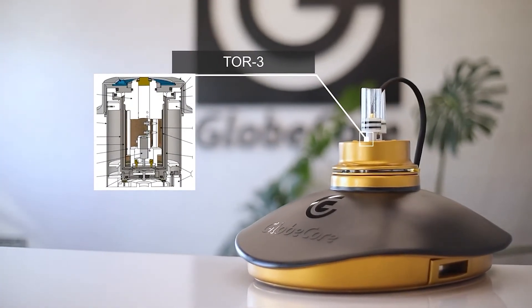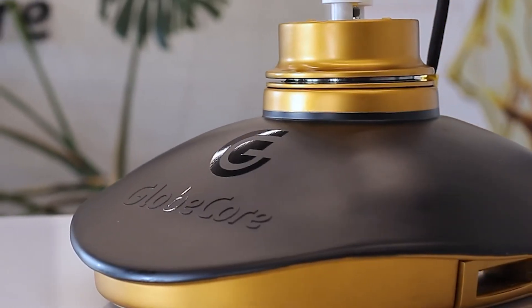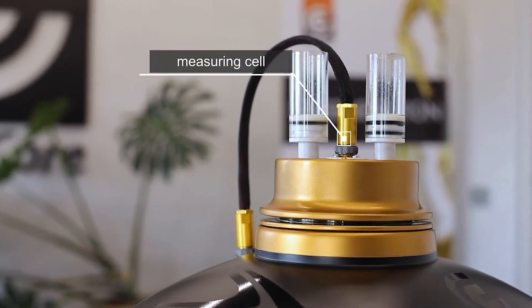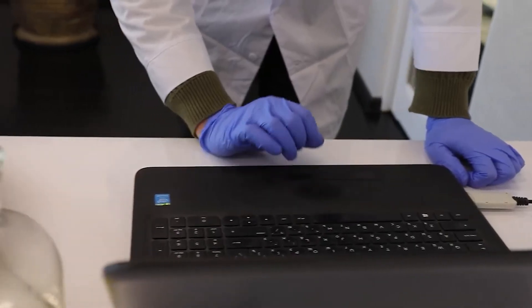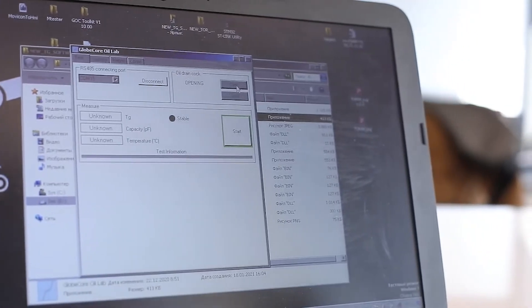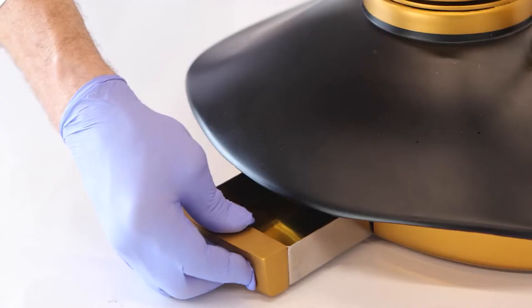For ease of use of the TOR-3 device, the transition to testing the next samples is done without removing the cell. Simply send a command from the computer to open the oil drain valve, let the oil flow into the special tray, and then place a new sample in the cell.